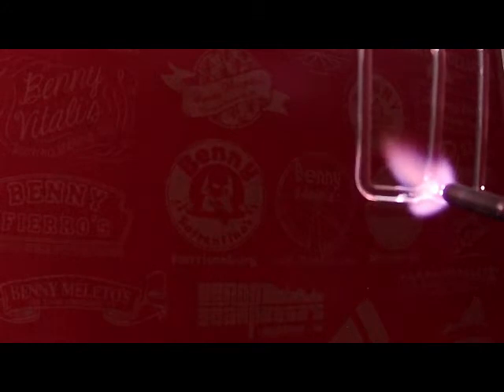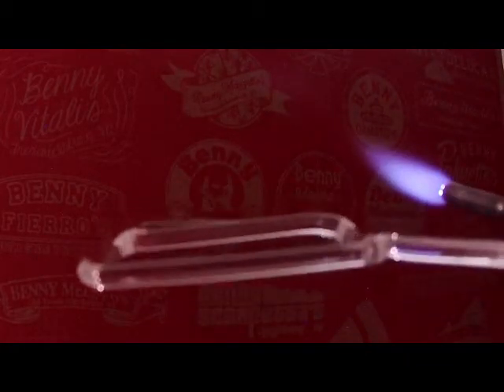Right now I'm freehanding everything. In other words, I haven't made any measurements. I'm not too concerned about this glass rod being exactly in the center. But it actually looks pretty close, maybe off by a couple millimeters. The other thing is, it's not perfectly level, but if I really wanted the middle rod to be in the same plane as the other two, I could keep working it, and then eventually, either with tweezers or a graphite rod, give it a little bit of a push to move it down. So that's why when I started, I had one of the glass rods in the plane and the other one was kind of on the top, just because it's easier.